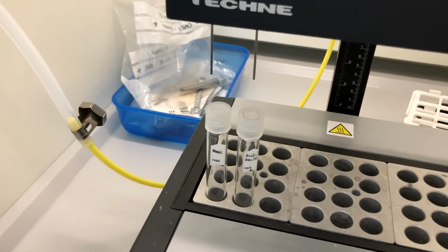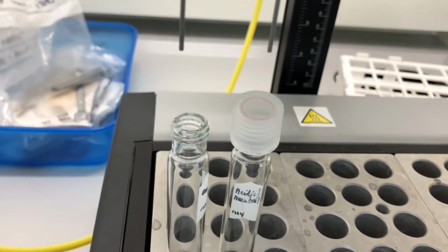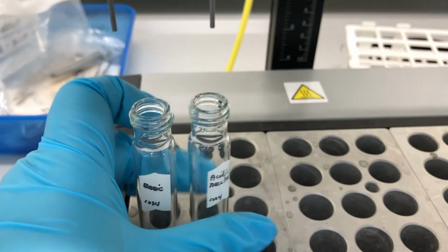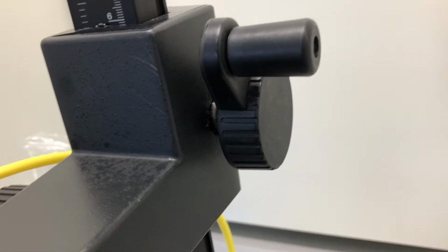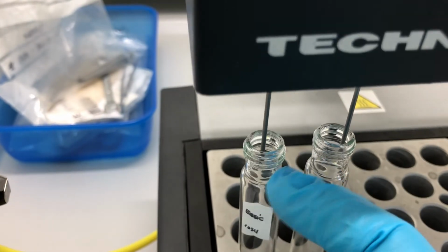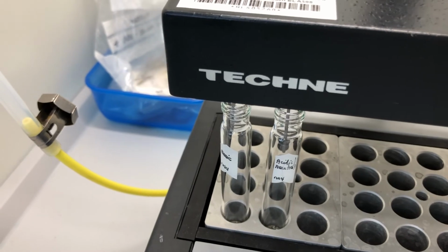So we've placed our test tubes into the sample concentrator. We will remove the lids from the test tubes, and we will make sure that as we lower the lid, the spikes where nitrogen gas is passing through them go straight down into the test tube. Now, please make sure that the little spikes are actually inside the test tube. You will see here that one is just hitting the rim of the tube, and if I just push it over slightly, the nitrogen will now be going down through the tube.